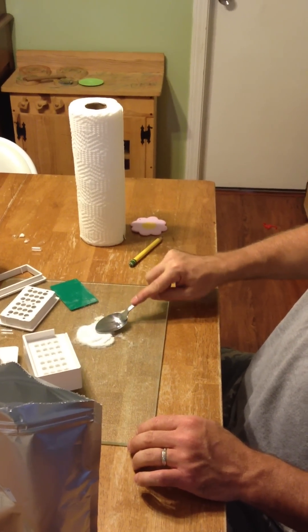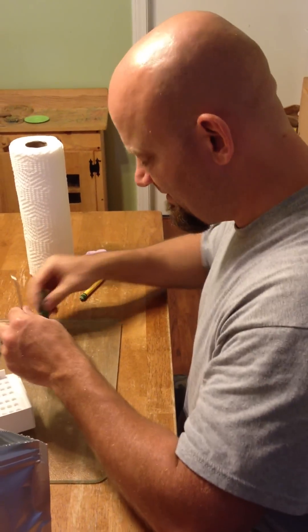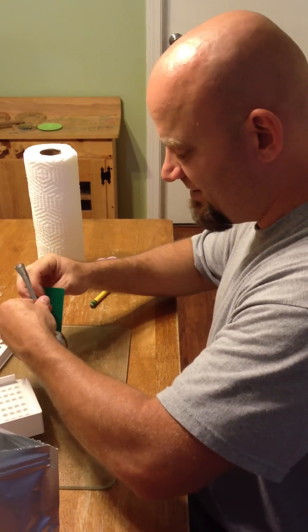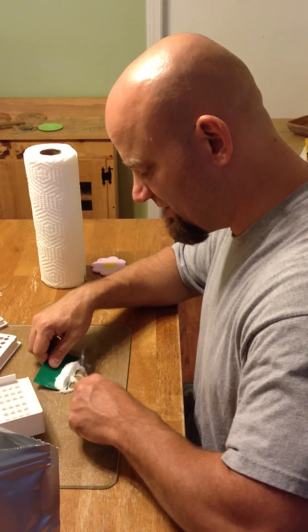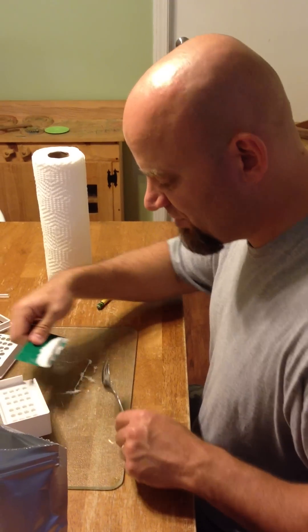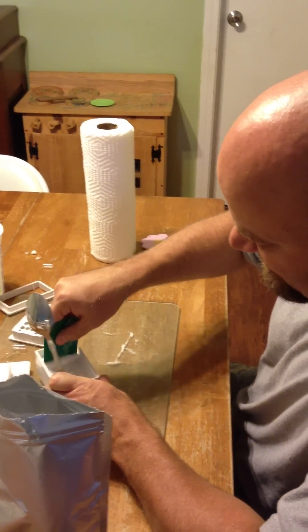That's Ivy, my youngest daughter. This totally looks like drugs — I guess it is drugs, it is Piracetam. But it is a nootropic drug. It is not to get you high; it is to make you focus and help you focus better.